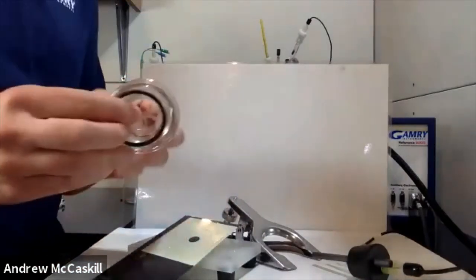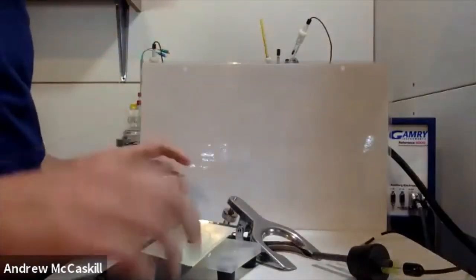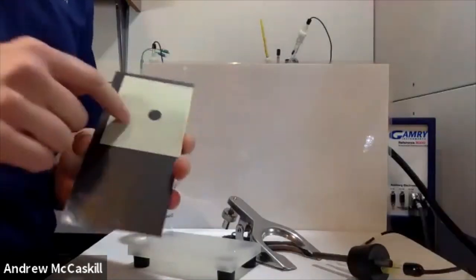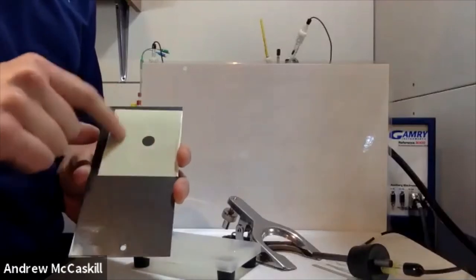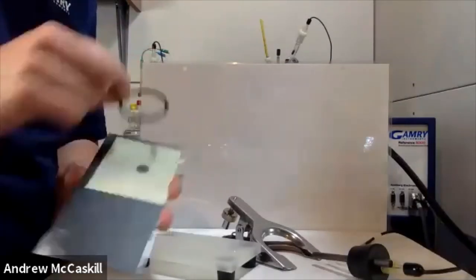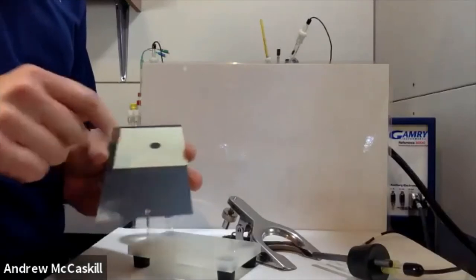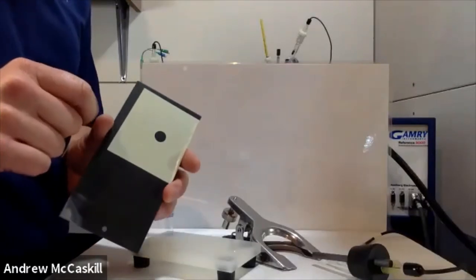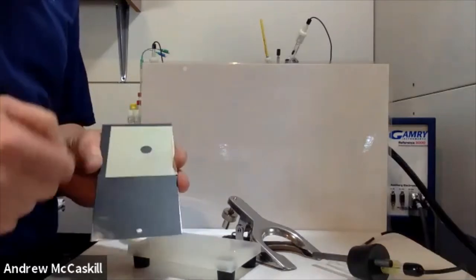This is just an open-ended cylinder, opened on both sides, and the reason for that is that we can expose just this one small spot on the coated sample. This is one of our sample masks. The reason I have this on here is to avoid edge effects around where the o-ring makes contact with the sample. It also helps you get a better idea of the actual surface area you're studying. These can be really effective if you're noticing a lot of variance in your data caused by edge effects.